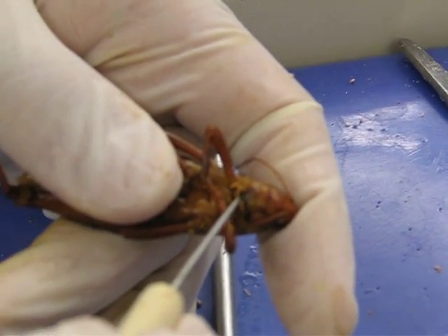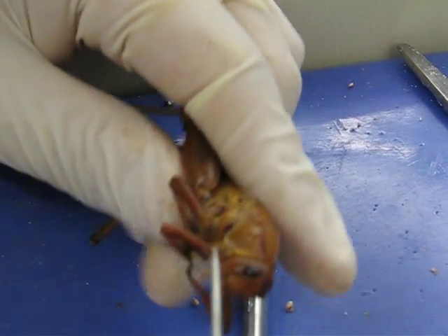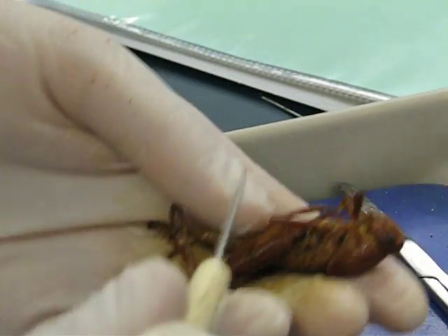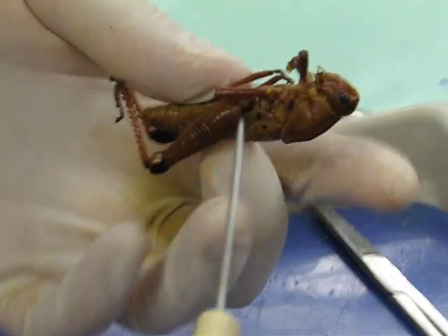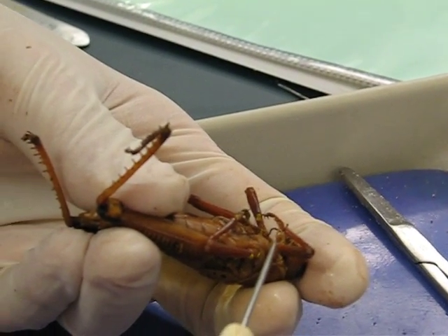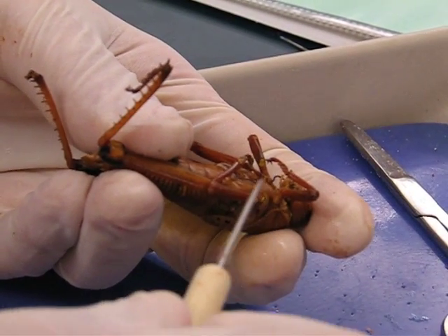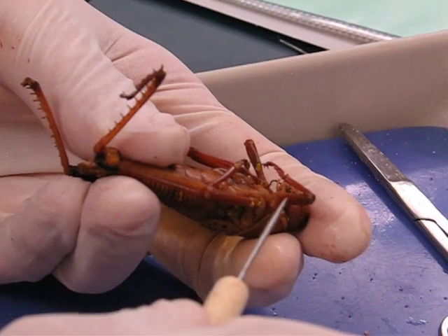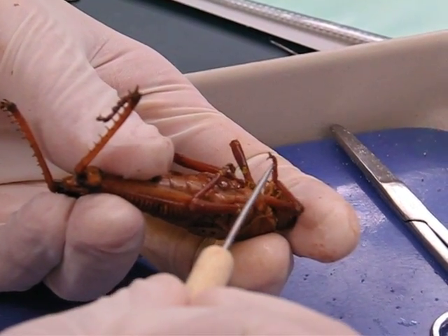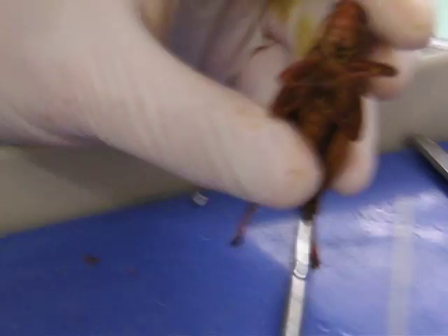They have just a tail. Wings. Wings. Coxa. Coxa. Femur. Femur. Tibia. And last one is tarsus. Tarsus. Is that it? Oh, good job guys!